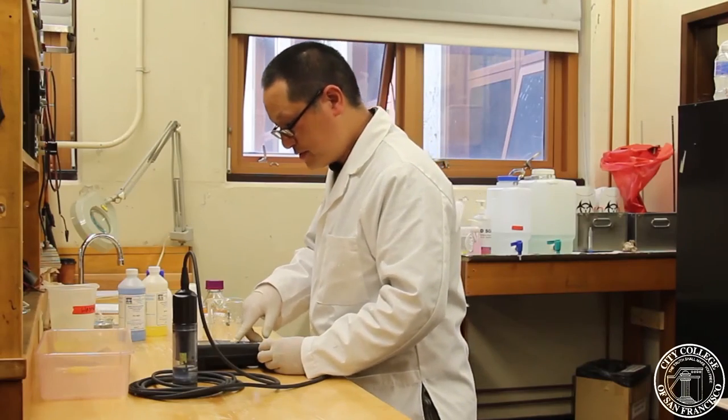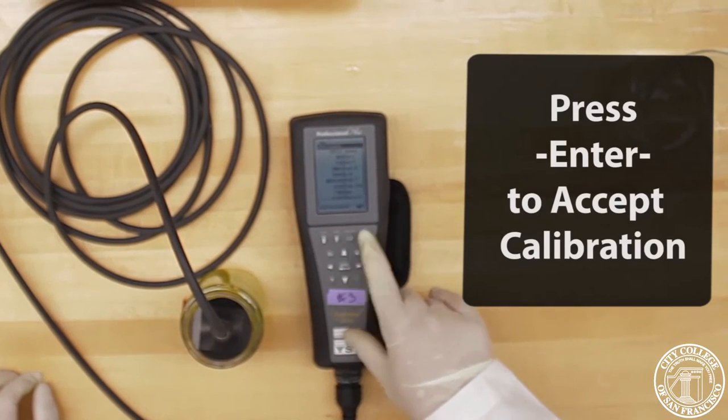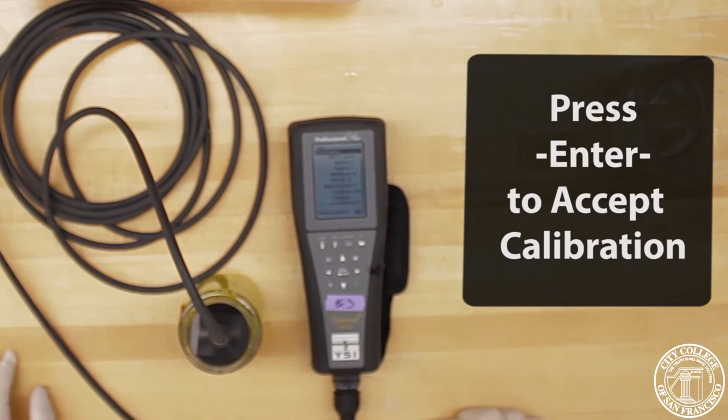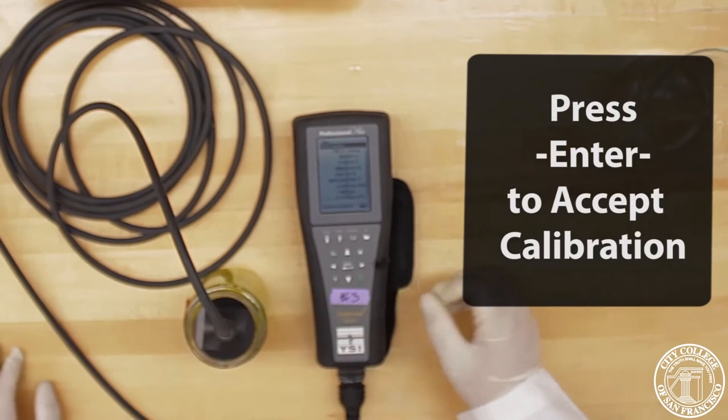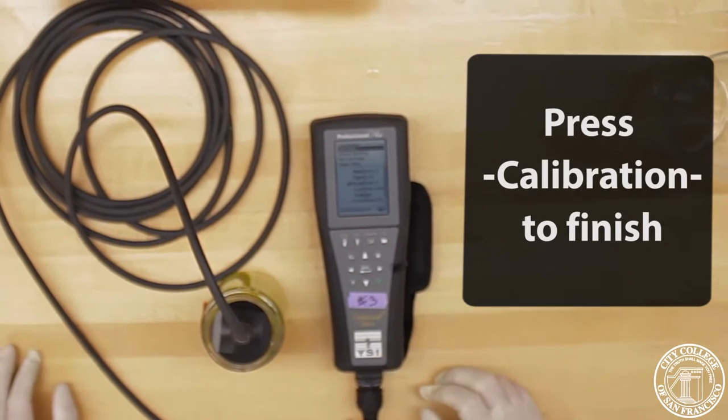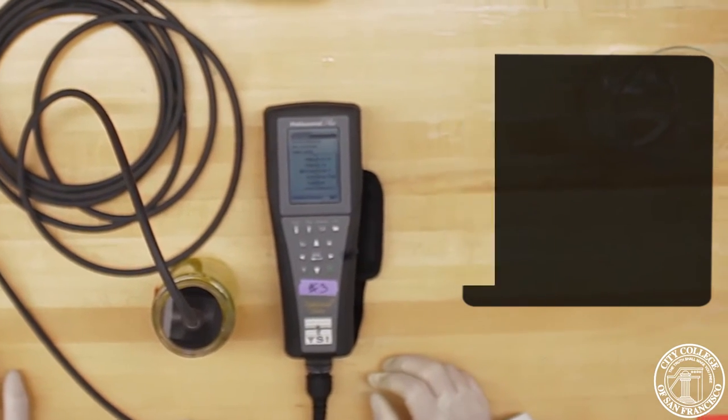And once we're done with that, we press accept calibration. Again, it'll ask us for press CAL to finish, press ESC to abort or ready for point 3, which we're not.